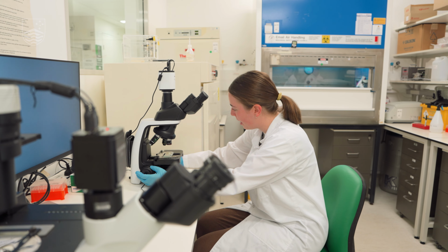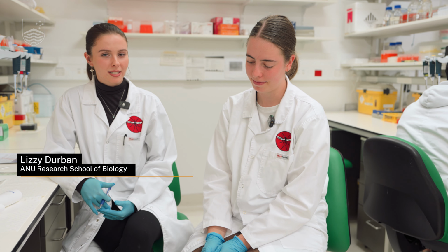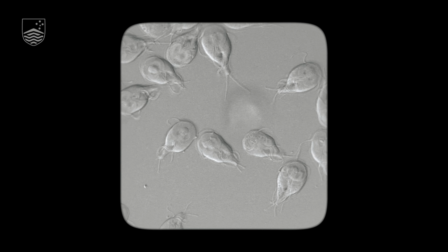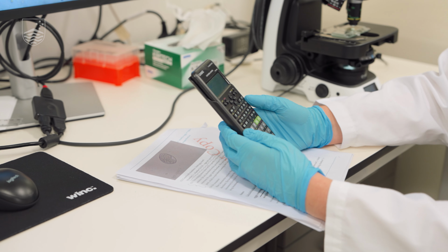Hi, I'm Sabina. I'm a first-year PhD student here in the Meyer Lab working on the human malaria parasite, Plasmodium falciparum. And I'm Lizzie. I'm also a PhD student in the Meyer Lab, but I work on the gastrointestinal parasite Giardia. Today, we're just going to show you a side project of ours, which is a poo float.